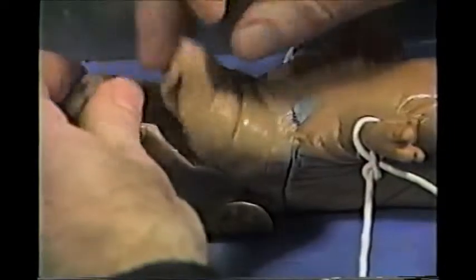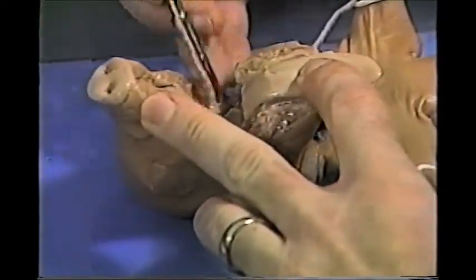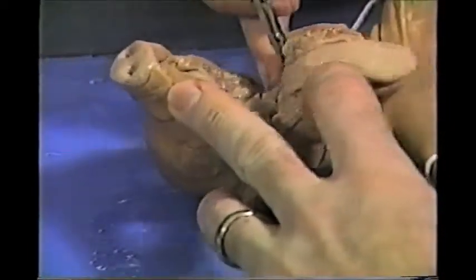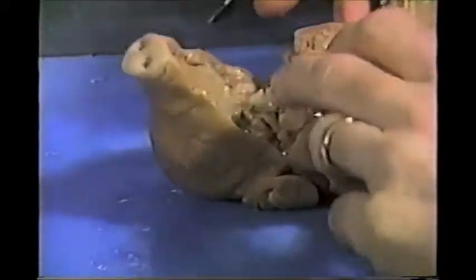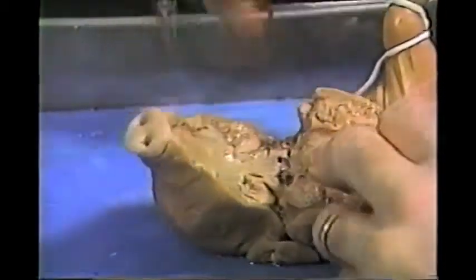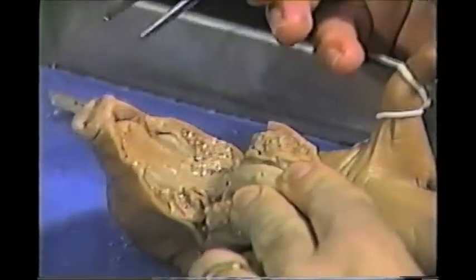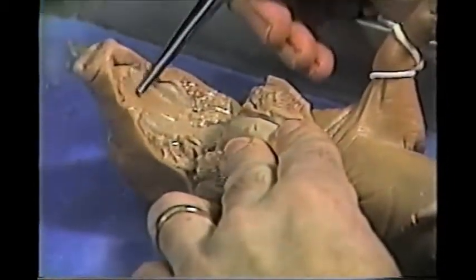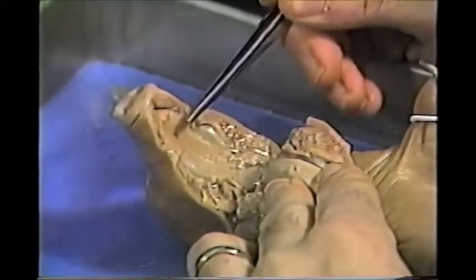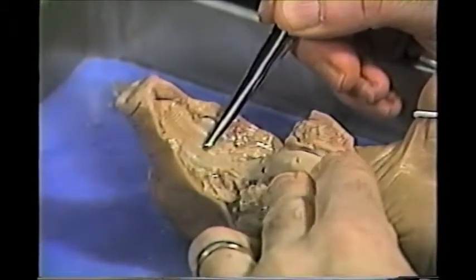Okay, now we can pull this down, and we'll make a little bit more of an incision till we can see the epiglottis. Okay, now I'll take the forceps. Here is the hard palate. If you feel that it's hard, you can see the ridges, similar to the drawing in your textbook.